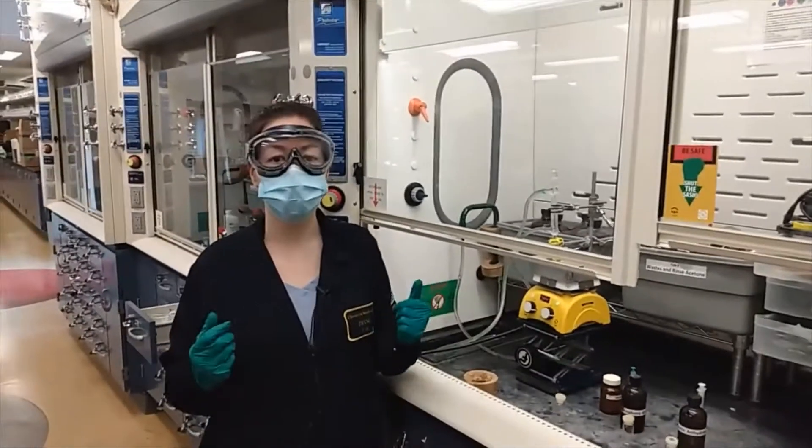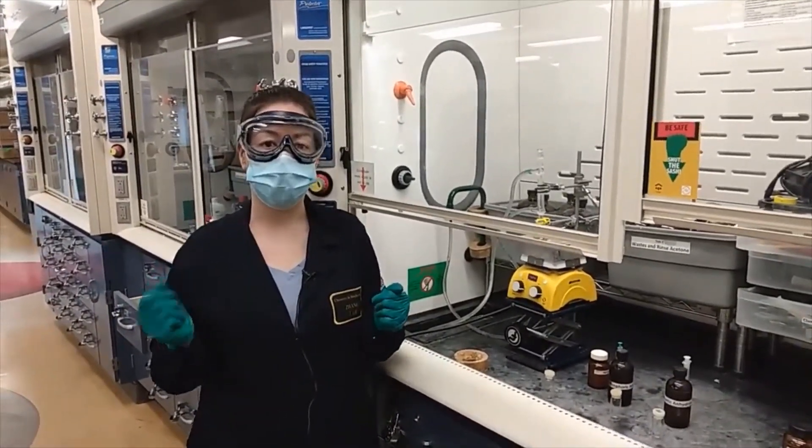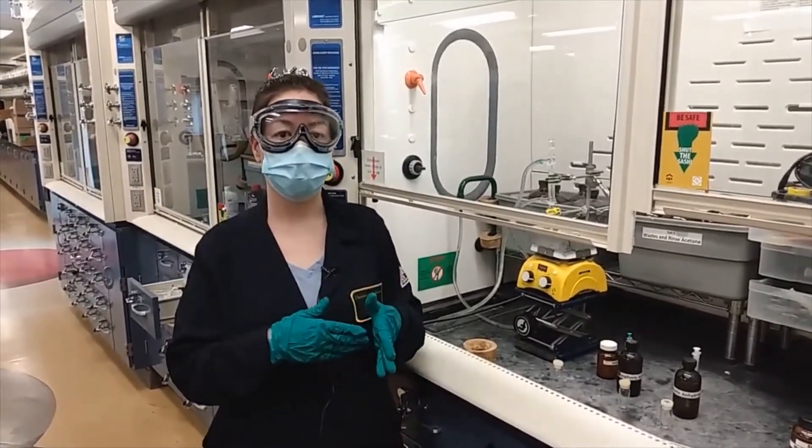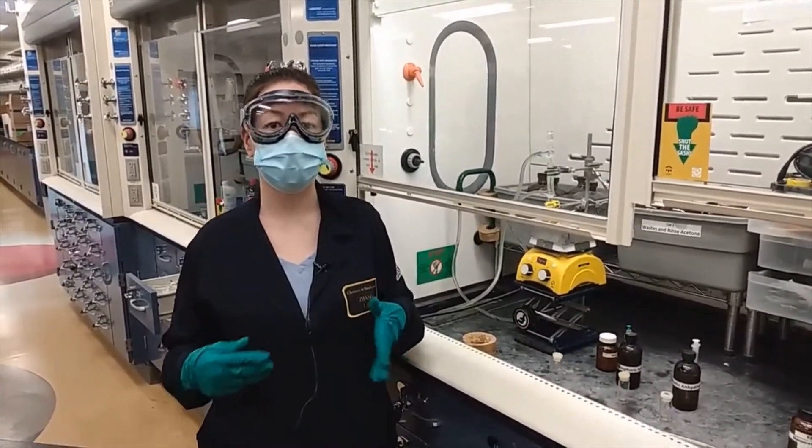We'll take aliquots at 5 minutes and 10 minutes to monitor the progress of the reaction, and then we'll check TLC at the end with the crude product and the ferrocene starting material to see how it looks.